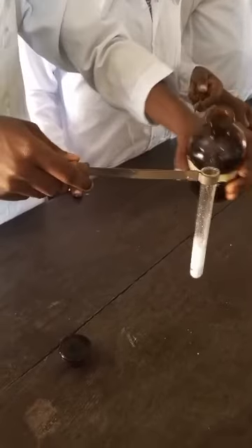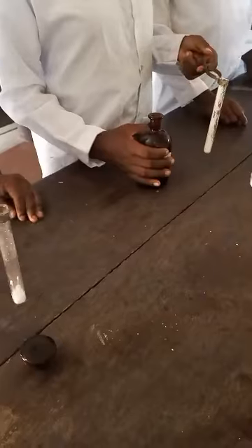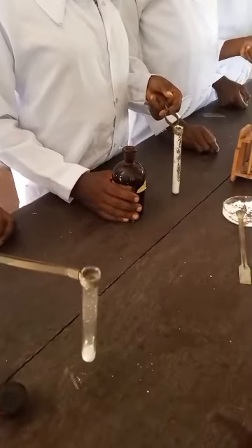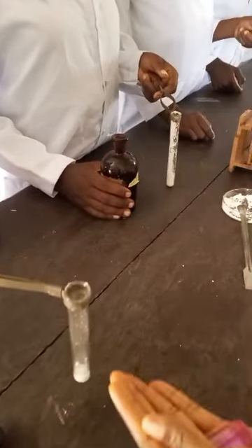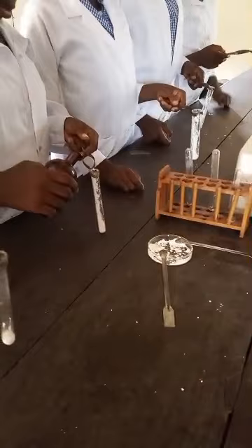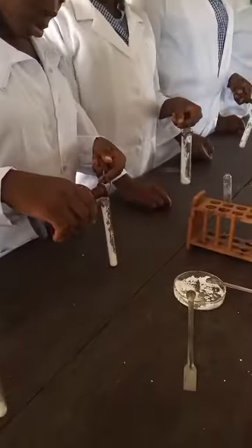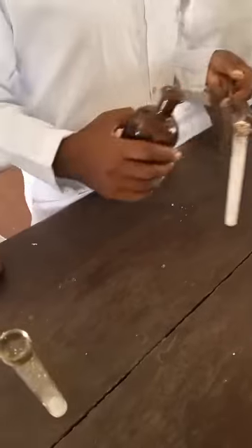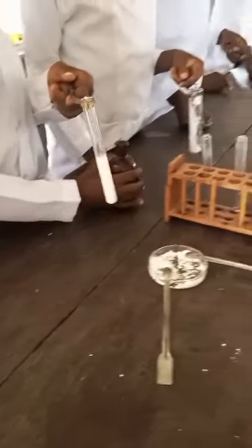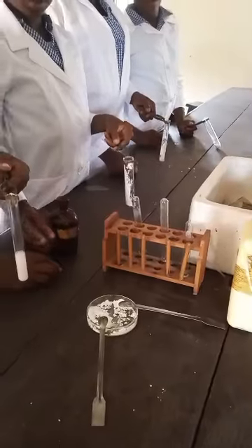Okay, bring it up. Can you see that? You see that the light just went off immediately I put it there, to show that carbon 4 oxide was evolving. So you notice the shh sound. That's the effervescence that happened and the carbon 4 oxide was liberated. Okay, let's try your own too. Because of our time, we may just test. Did you notice it? It will just quench the fire. That is why it is used to produce fire extinguishers, because it does not support combustion.